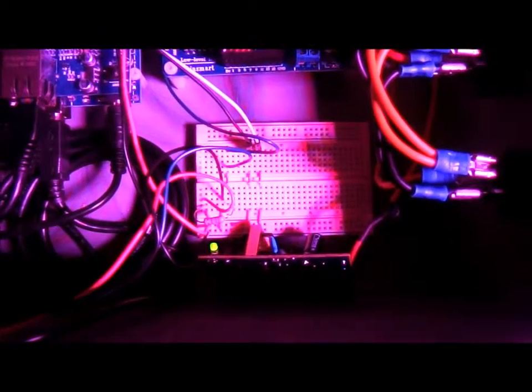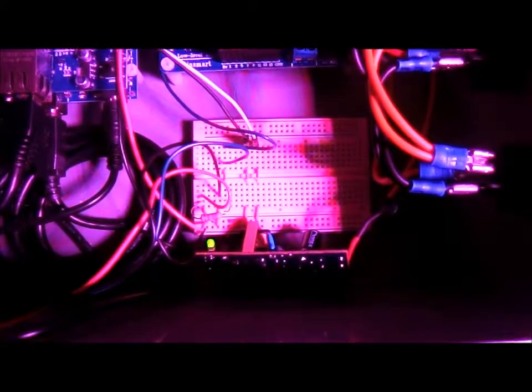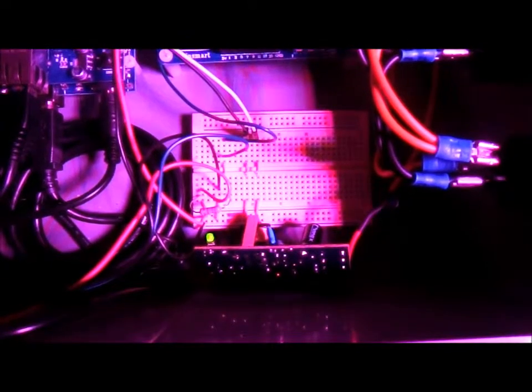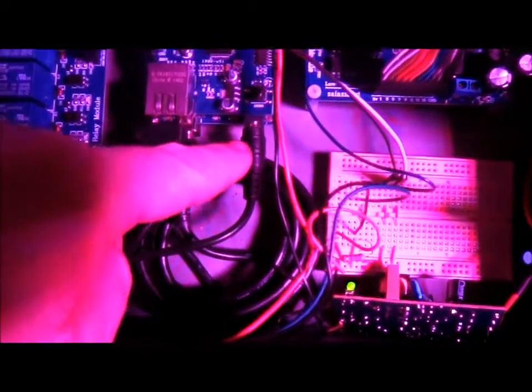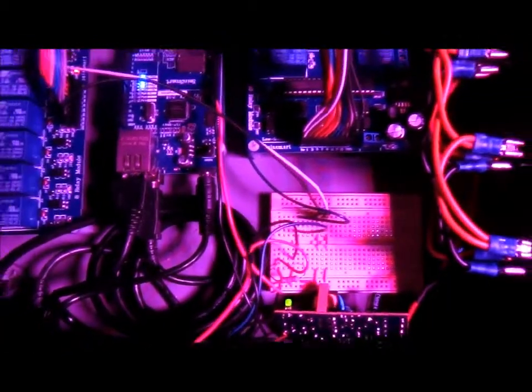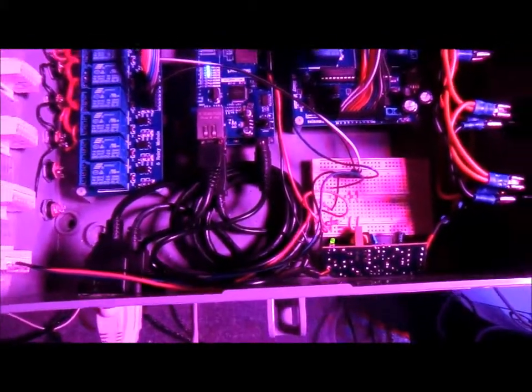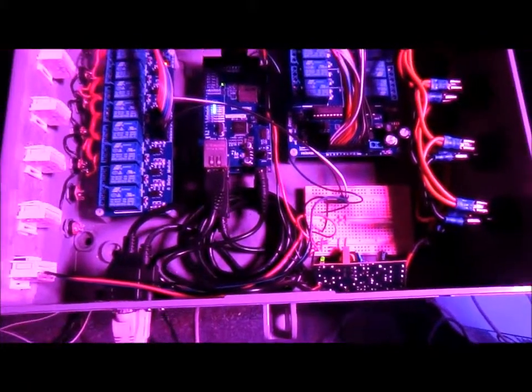Inside of a normal adapter that you would buy, kind of like a cell phone adapter, and I just took it apart and took the guts out so that I can plug the Arduino in right here, all off of the same bus. So everything's powered by a single unit, by a single switch with a fuse on it.